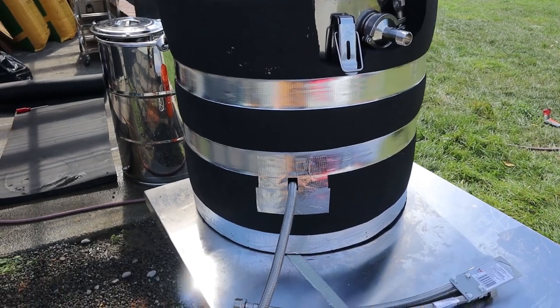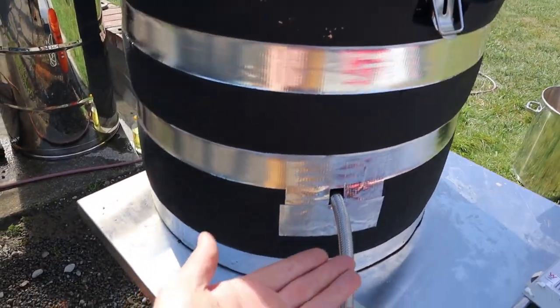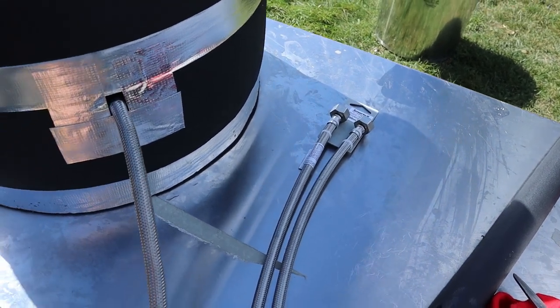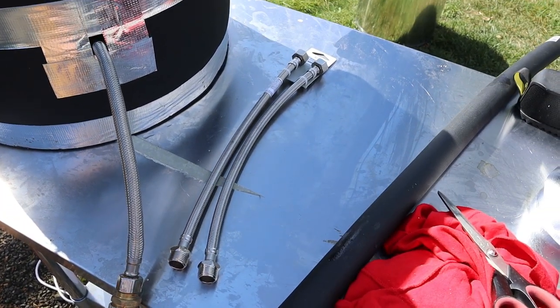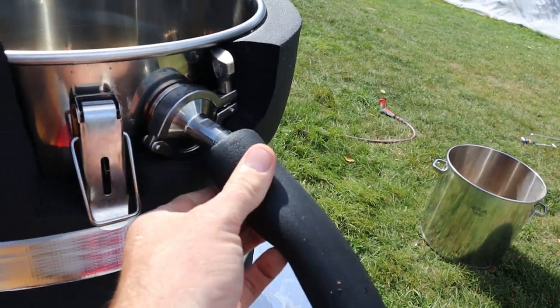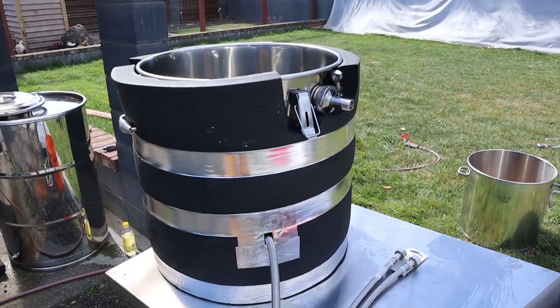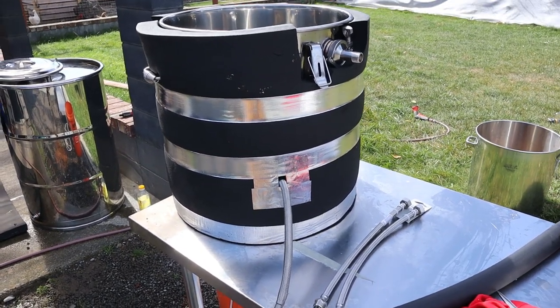This tape has a real high tack and doesn't wear away quickly, so it should stay on for quite some time. There's nothing on the bottom yet — I'll just sit it on a sheet of Kflex to insulate underneath, and the top comes insulated. To connect from here down to the drum connection I'm going to try these hose fittings — they're only rated to 90 degrees and I'm going to put 99 degrees through them, so we'll see how they go. I'll wrap them with Kflex sheeting. I've got a thermometer on the top of the barrel to see how hot it gets, and I'll time how long it takes to reach close to 100 degrees.